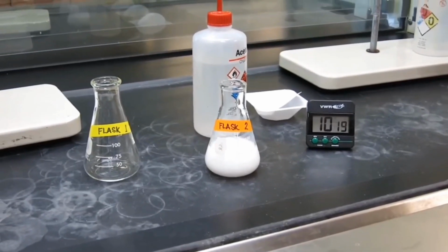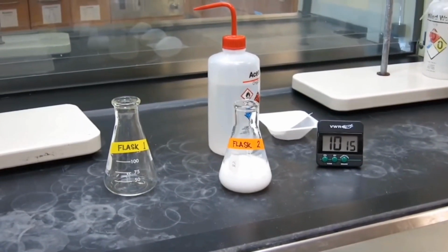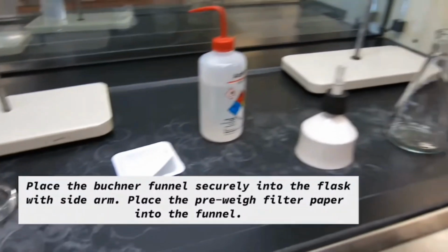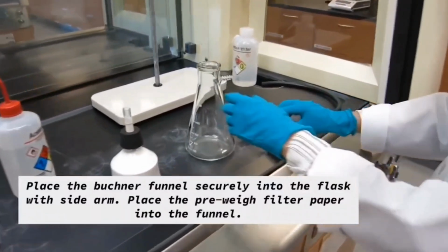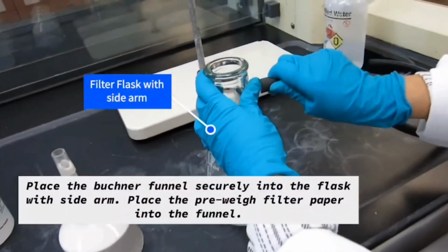And what we have in the flask is the calcium carbonate, which is your white precipitate, and the sodium chloride, which is going to be soluble in water. After 10 minutes, we're going to do a vacuum filtration to separate calcium carbonate from sodium chloride.